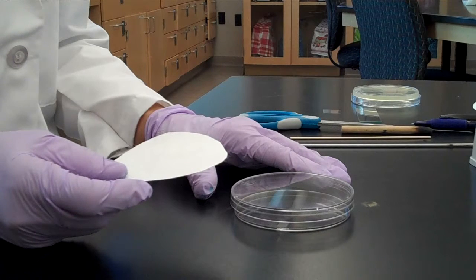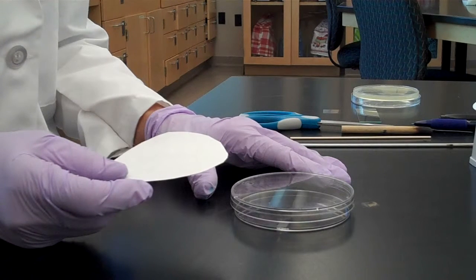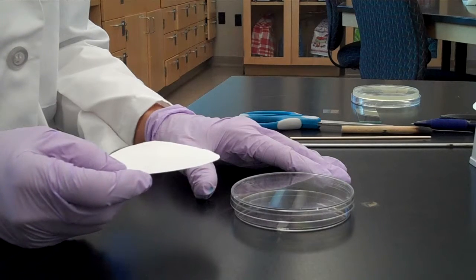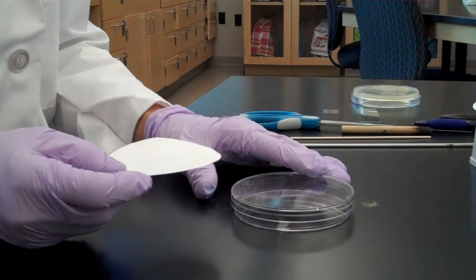We're going to demonstrate some of the assignments from the fungi exercise. First, we're going to demonstrate the prepare a mold slide culture portion of the fungus exercise.